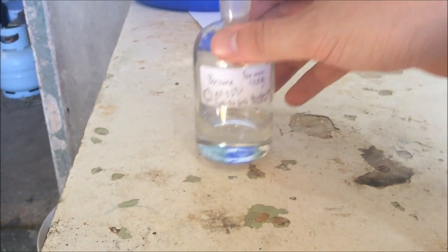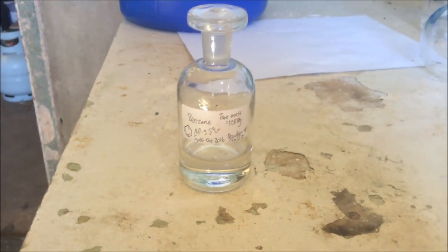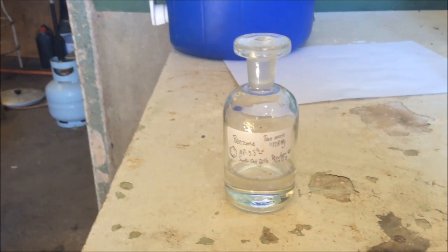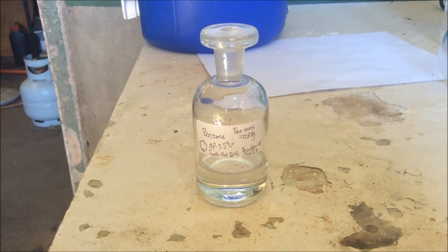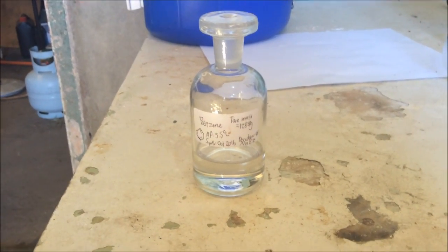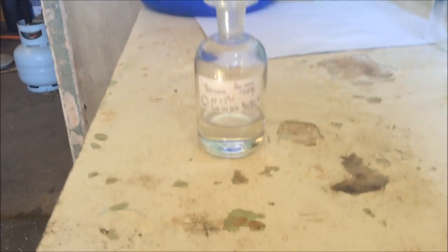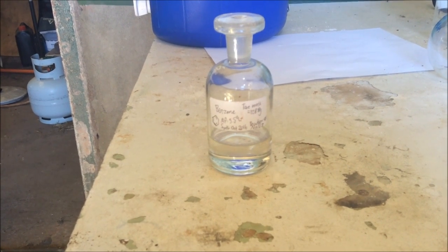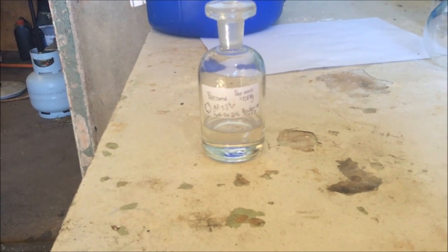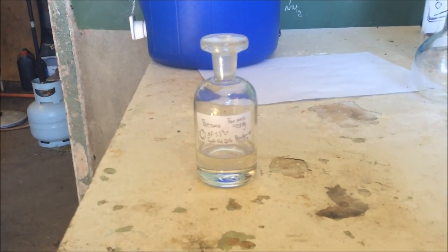Our final yield of benzene is 33.8 grams, which corresponds to a 62% yield based entirely on the benzoate method. There were a couple of mils from the terephthalate method, so that puts the benzoate yield at about 55%. But it's pretty good — I'm actually really impressed with it. Which is a bit disappointing because that's the method we're competing with here, the decarboxylation of PET. In conclusion, the PET hydrolysis and then decarboxylation really wasn't a good method — it was very inefficient, took a very long time, I couldn't recover the ethylene glycol, and it didn't give much benzene. It really had no advantages.